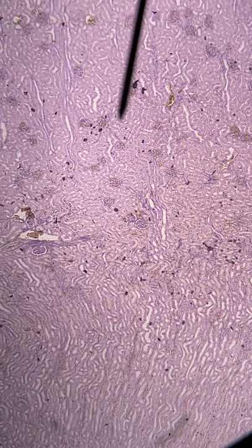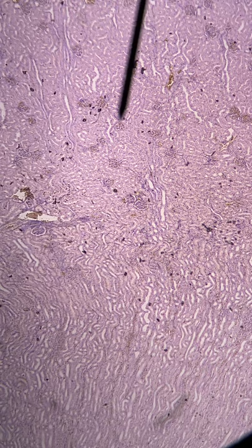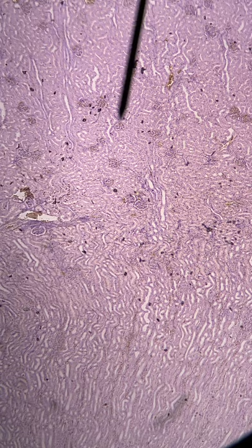That little spot right there is a corpuscle — that's a renal corpuscle — which consists of the inside being that ball of capillaries, the glomerulus, and the outside being that Bowman's or glomerular capsule.